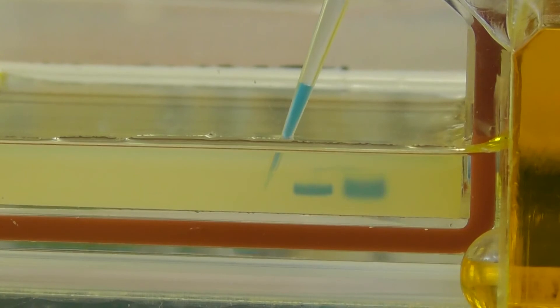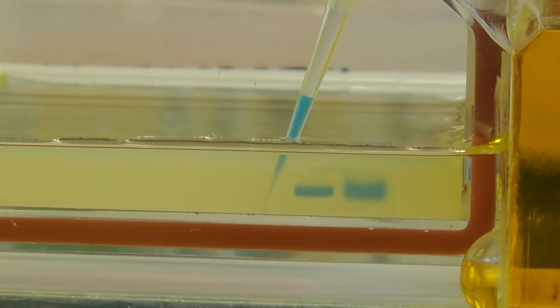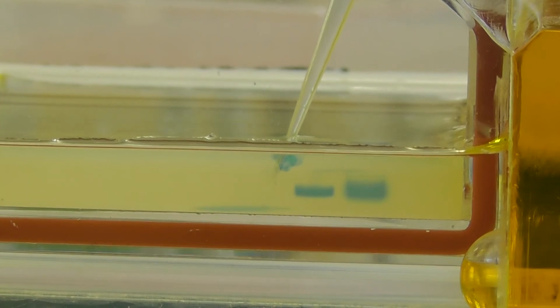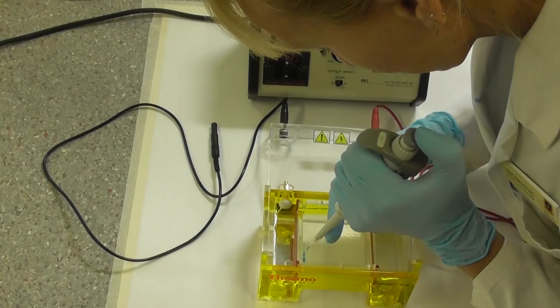Avoid stabbing the pipette tip into the gel along with pipetting too quickly, as this will also result in insufficient sample being loaded. When loading the gel, find a position that is comfortable. Here, my left elbow is on the bench, whilst my right hand is supporting the barrel of the pipette.